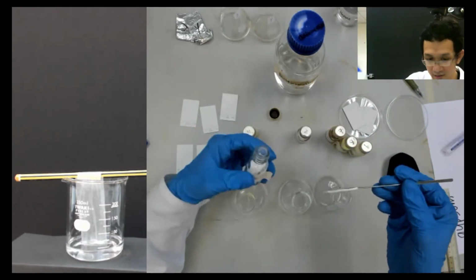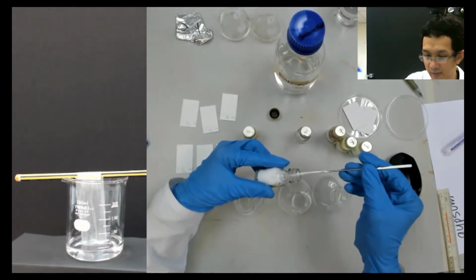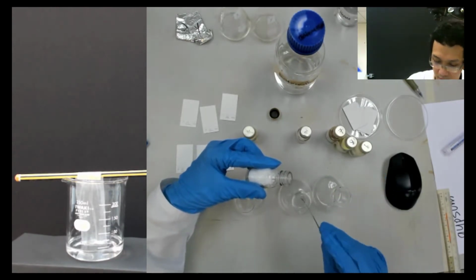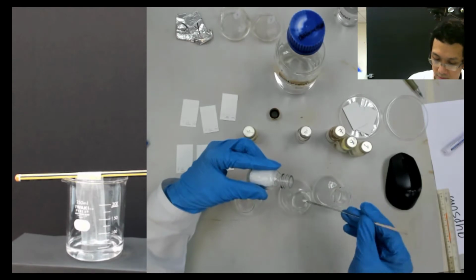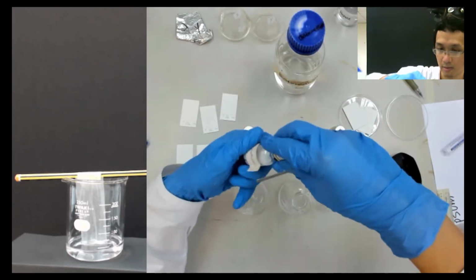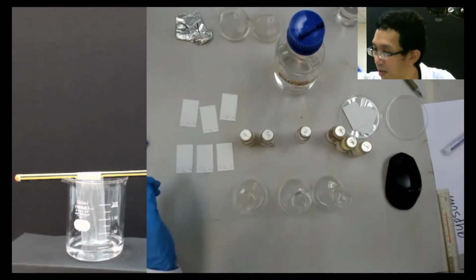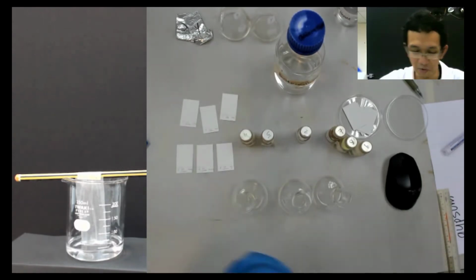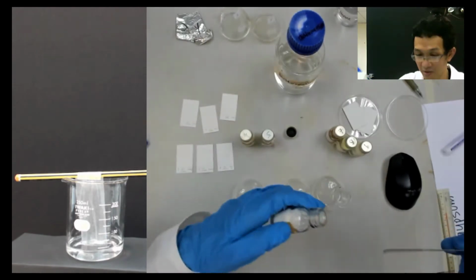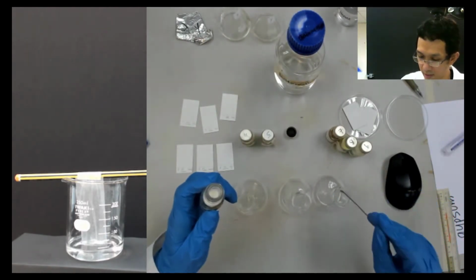So this is naphthalene. One, two. Can you see? It's okay, right? Yes, I can see. That's the problem with this online thing, because I don't know whether you are still there or not. If you are in the lab, then I know you are in front of me. But we manage. It's okay. Vanillin. Okay.